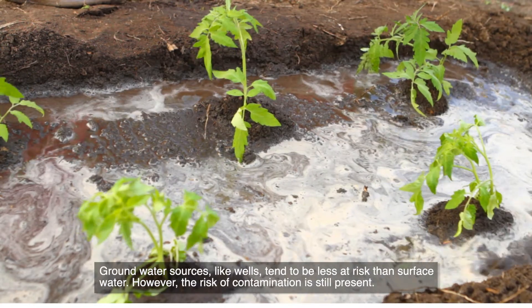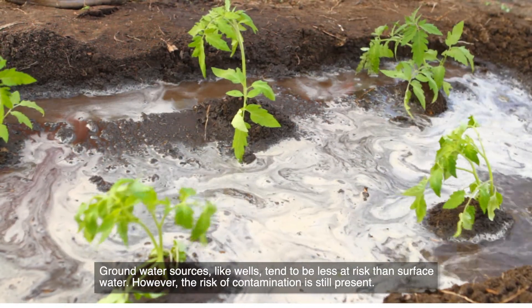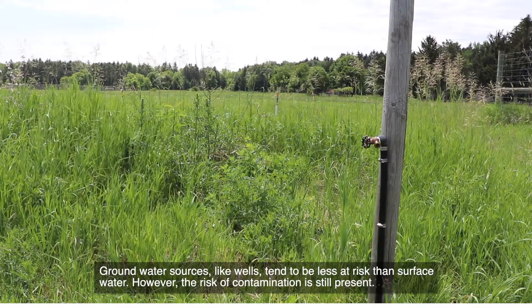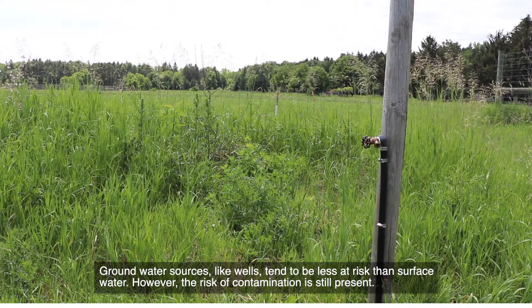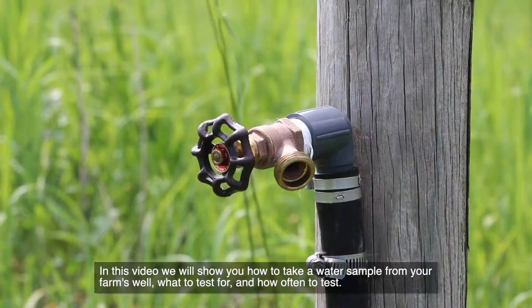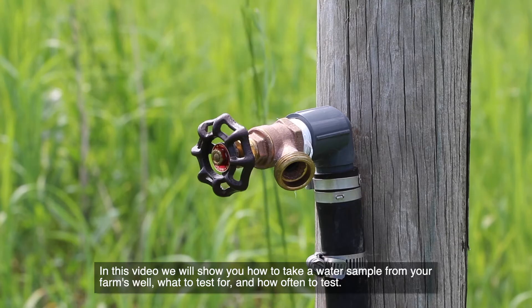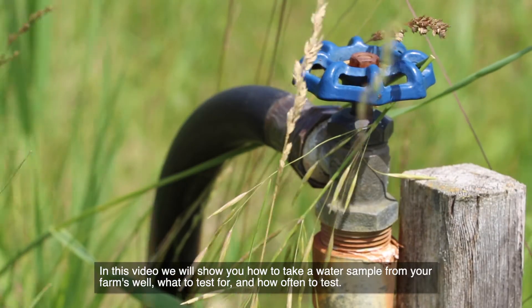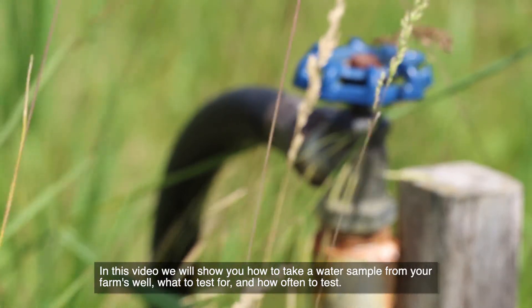Surface waters are susceptible to contamination from animals and other sources. Groundwater sources like wells tend to be less at risk than surface water. However, the risk of contamination is still present. In this video, we will show you how to take a water sample from your farm's well, what to test for, and how often to test.